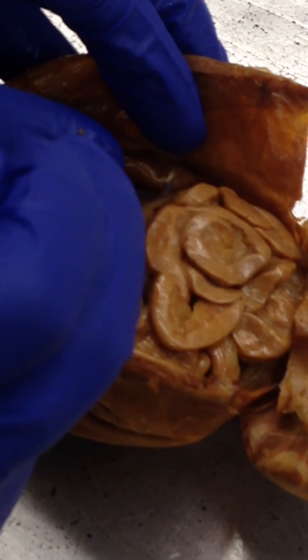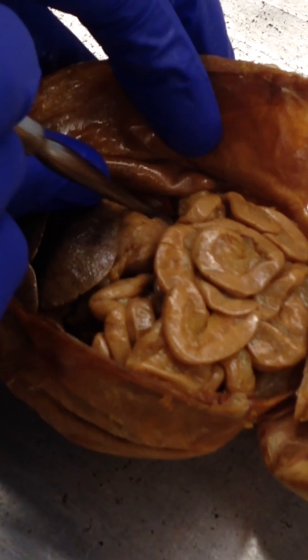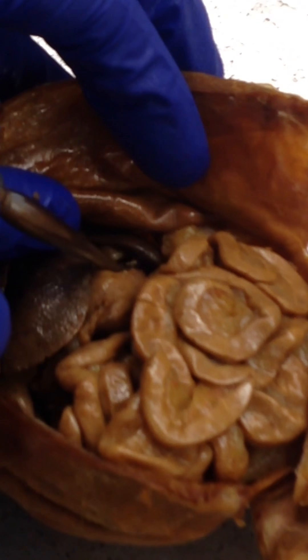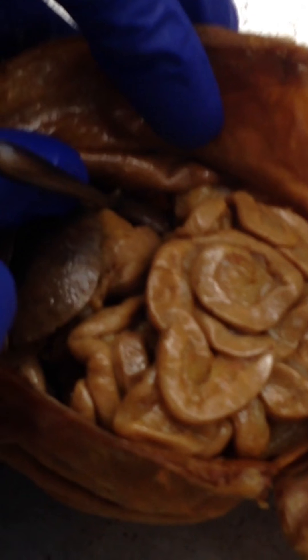Here's the spleen right here. Can you see that? It's the dark brown structure.